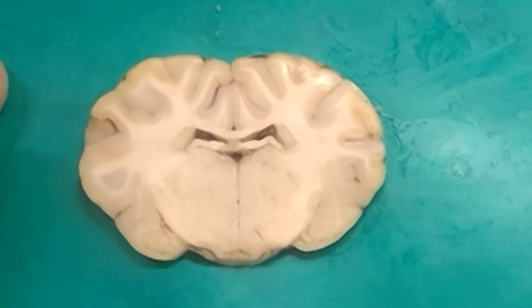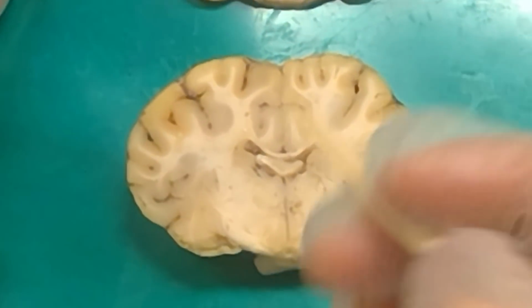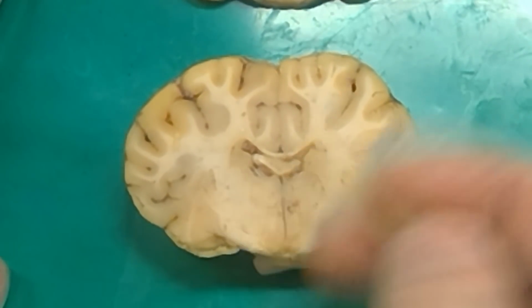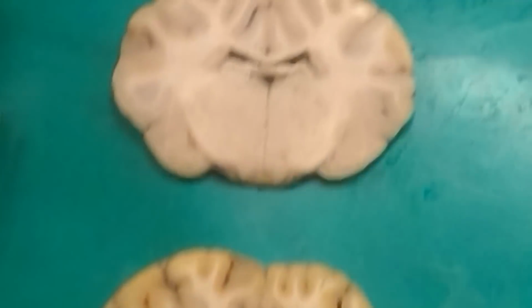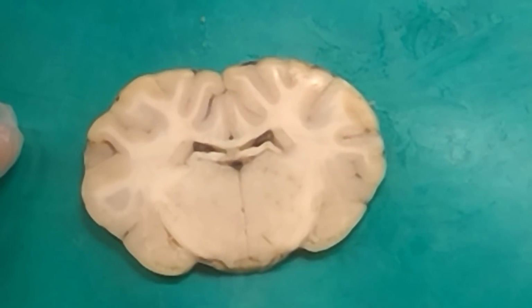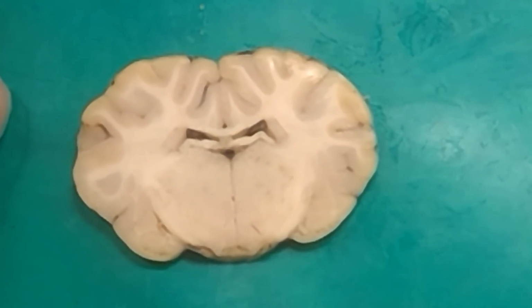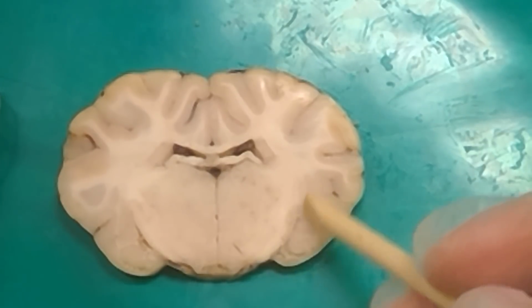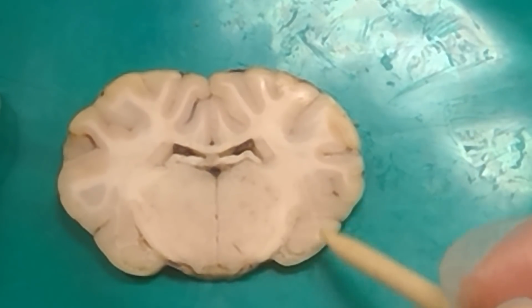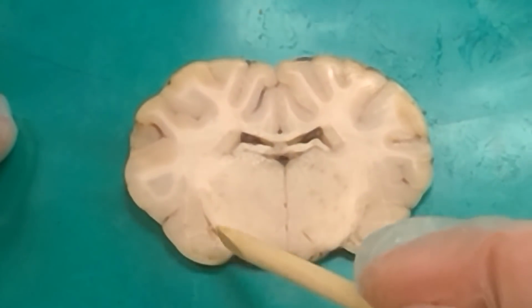If you can see any lines going through it, then it's hippocampus. So when we are at amygdala, which one was definitely amygdala? This guy. This is more, I don't really see any curves going in right there. It's not the best section. I would try to not make it confusing when we're looking at it, so I might not choose something like this. I might choose something where you can definitely see hippocampus at the top and bottom. This side right here is more like amygdala, where you can see it's got this smooth shape to it. It doesn't have any white lines going through it or curling around in there. So that side is more amygdala. This is more hippocampus over here.